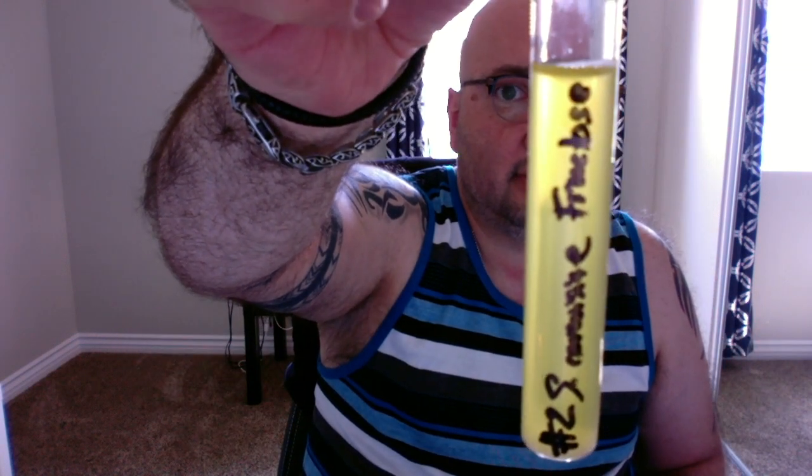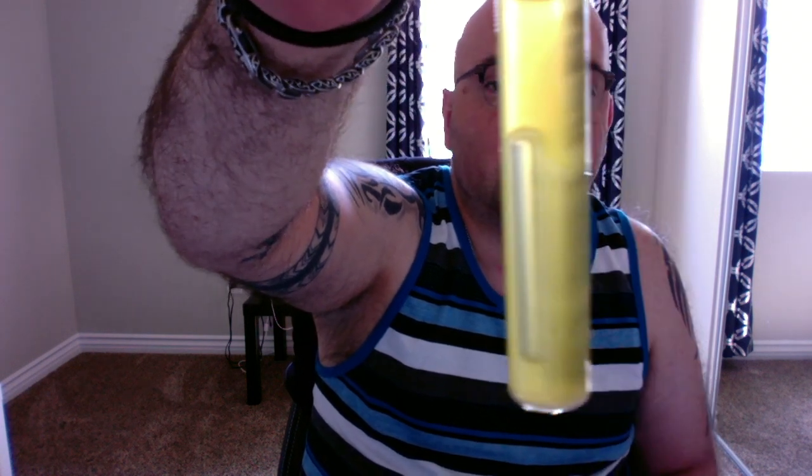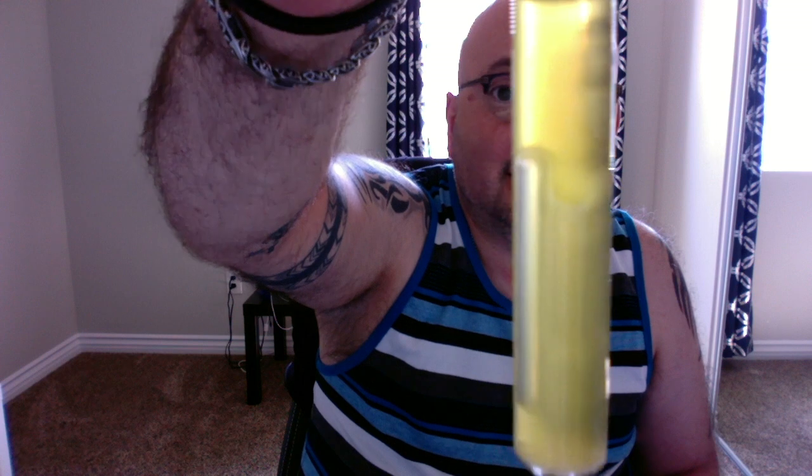Alright, so now we're going to move on to fructose with the S. cerevisiae. So again, here is number 2, S. cerevisiae fructose. And again, we have the yellow color. So again, looking at the pH scale, we have yellow. But the Durham tube itself is kind of at the bottom. There does seem to be some gas here, but not much going on. And the Durham tube itself isn't floating. I don't see any clear gas bubble in there. But there is a little light layer of foam, if you can see up here.